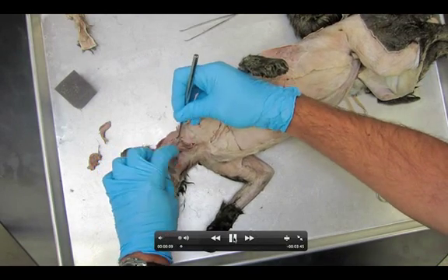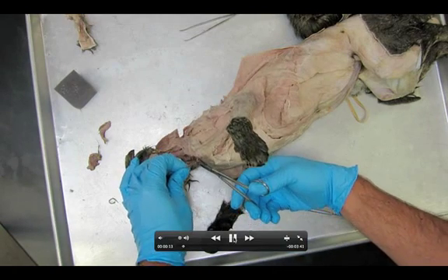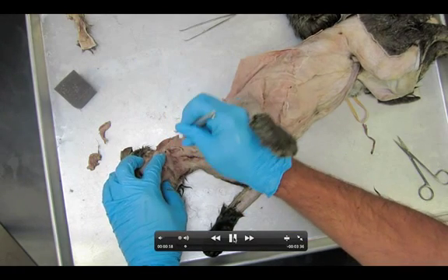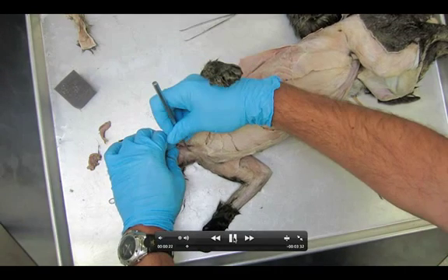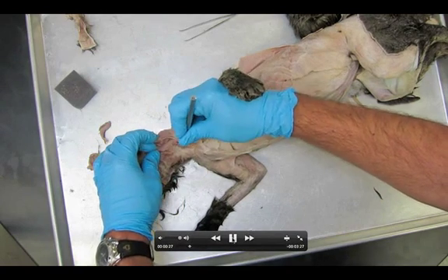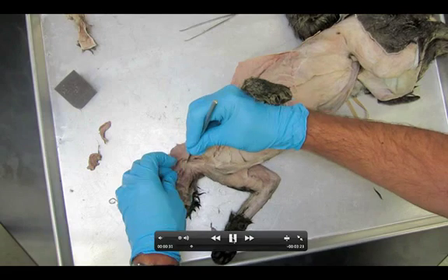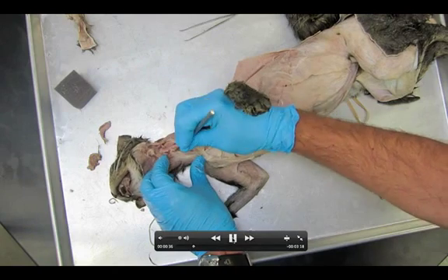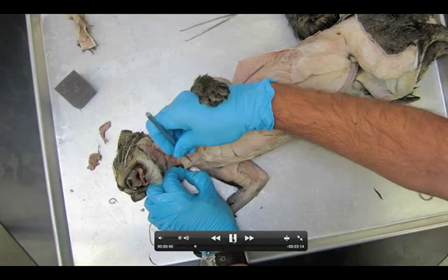Once my hands are out of the way, I'll pause this video and we can see some of the muscles that we should hopefully find on our cat. I'm removing the rest of the jugular vein right there and trying to clear up the sternomastoid as best I can. Right now I'm getting on the sternohyoid, removing some of the connective tissue. You've got to be very, very careful around the sternohyoid right there on the throat — it looks like I'm just shredding things, but you've got to be very careful when removing the superficial stuff, as these muscles can flake off extremely easy.